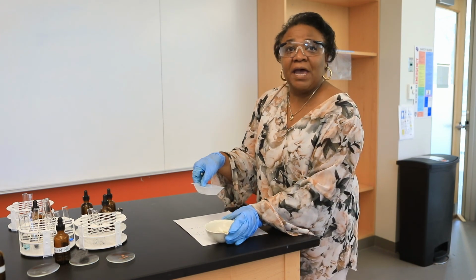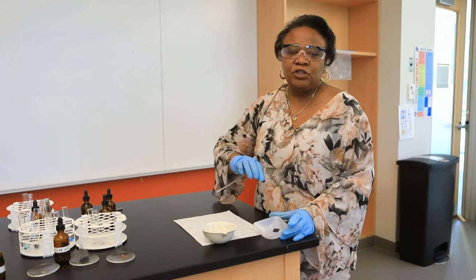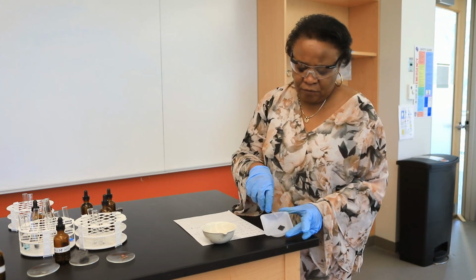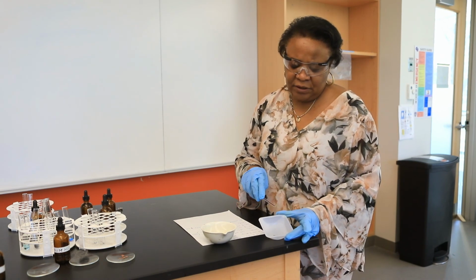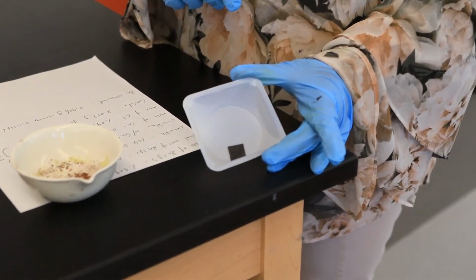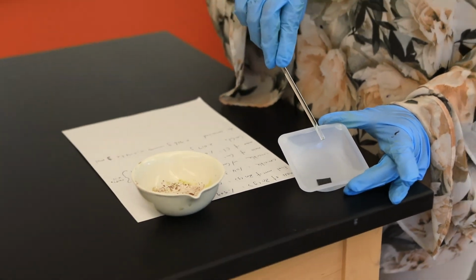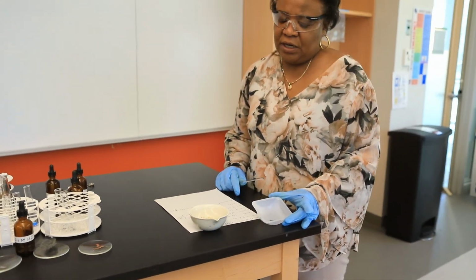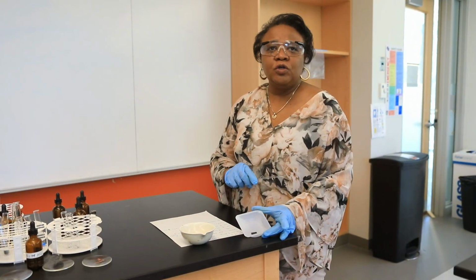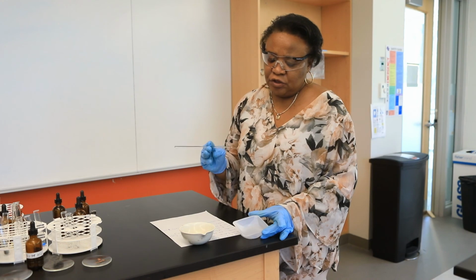Now, you also have the mass of the copper chloride solution. And so again, from that information, you can also determine the mass of Cl. Okay, and then finally, remember we started off with our zinc metal. The mass of zinc that we started with in the first half of this experiment was 1.909 grams. After the reaction is complete, please note this final mass of zinc is 0.953 grams. And so when you subtract those two values, you should also be able to report the mass of zinc that was actually consumed during this experiment.